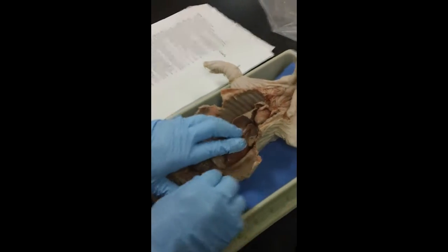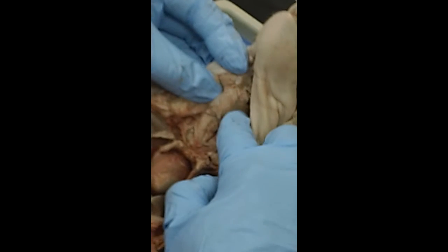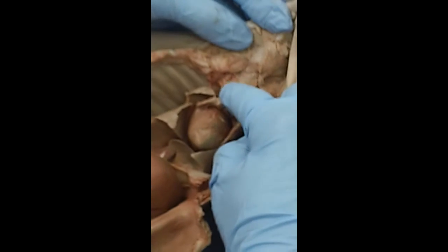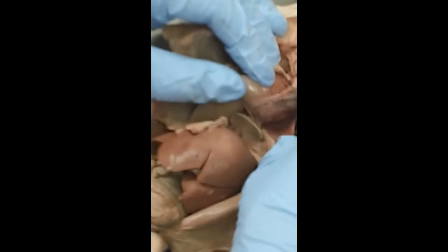Okay, moving to the thoracic cavity, we have the heart and the lungs. Up in here, this large area, the swollen hard area in the pig's throat, that is the larynx, which is the voice box. And if you follow that tube down, that has the rings of cartilage for support, that's your windpipe, which is the trachea. The trachea then divides into bronchi, and it goes into the right lung and the left lung. And the lungs, that is where carbon dioxide is removed and oxygen is replenished into the blood, from these spongy, soft lungs.